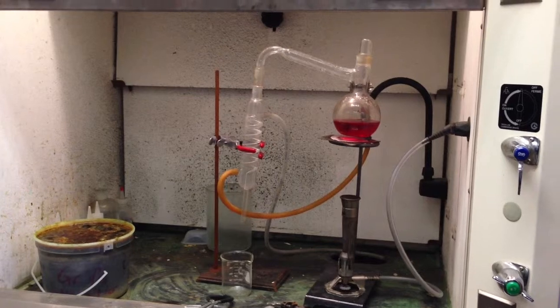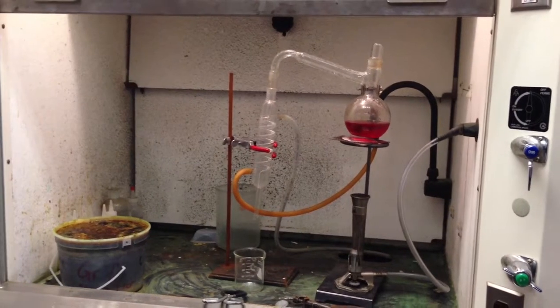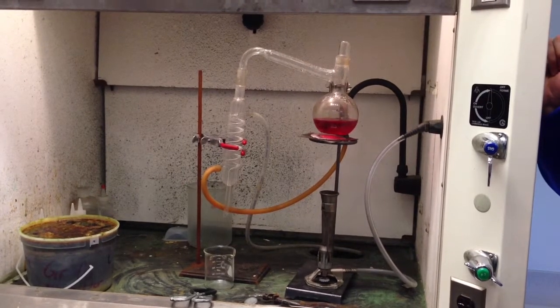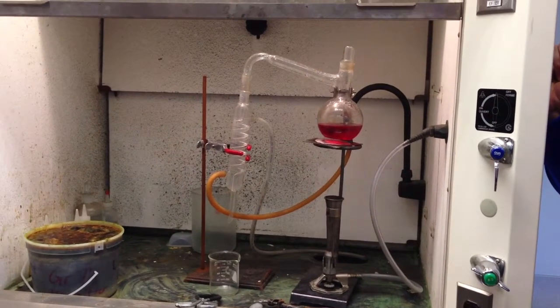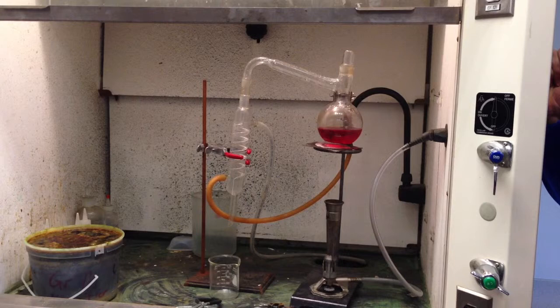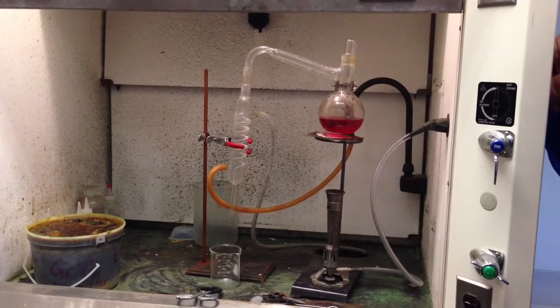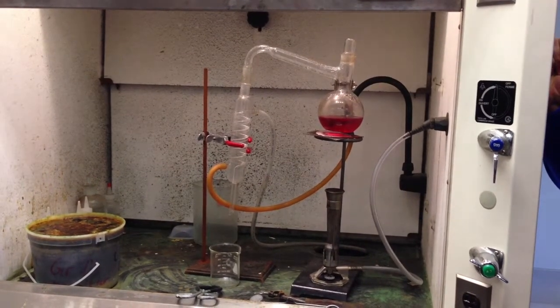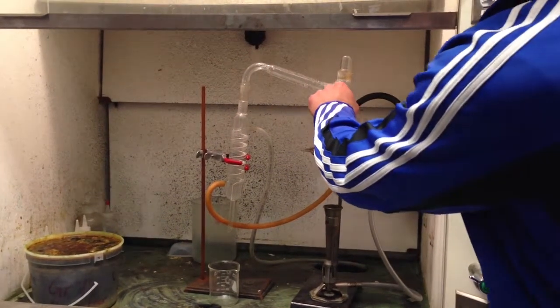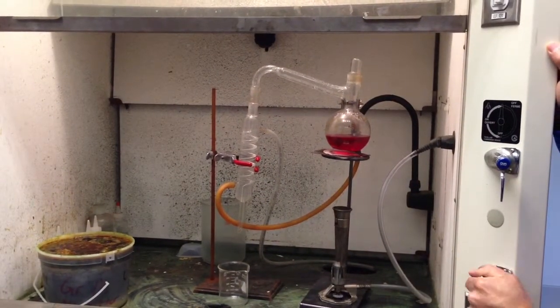Do you think that the red food coloring has the exact same boiling point as water? No. So when I heat up the mixture of water and food coloring, the temperature is going to rise and rise and rise. And then it's going to get to the point where one of the two liquids starts to boil. And then for reasons that I'm going to explain in a later class, the temperature actually stops rising. And it can't go any higher until all of the first material is gone. And so we're going to start making a bunch of vapor. The vapor is going to move along this tube here, and then it's going to come down this tube into the spiral. And I'm going to turn on the water right now.